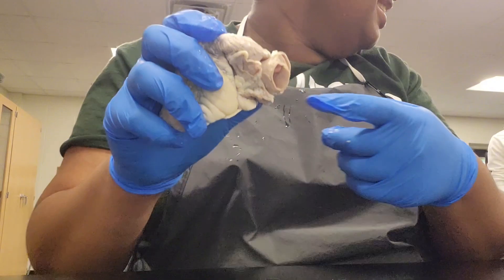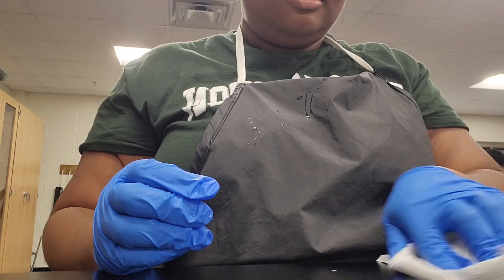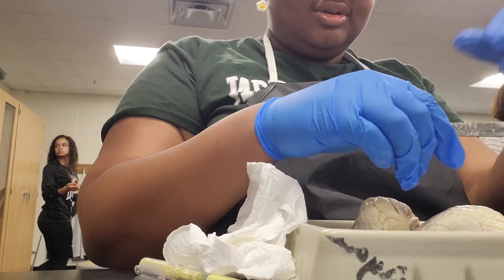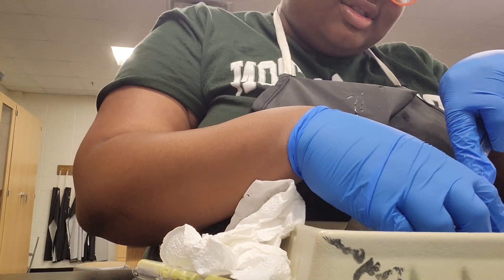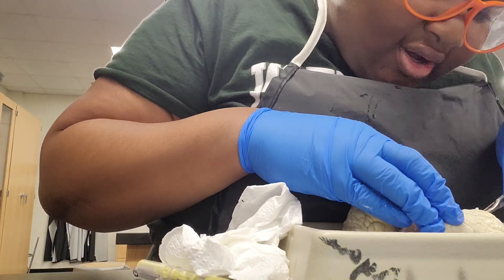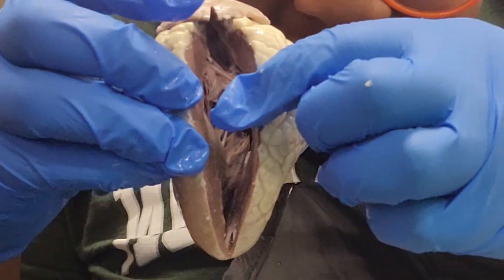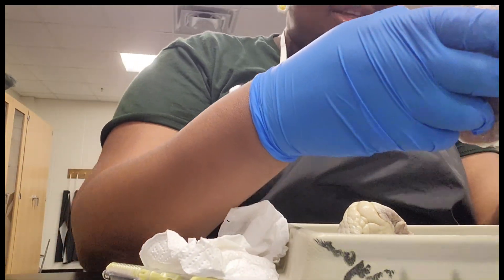I apologize for the weird unfunny jokes — I was on two hours of sleep and a vitamin energy when I walked in here, so I was loopy. Then I proceeded to dissect the heart even more because I was trying to see the heartstrings and find where that cavity went. Here we can get a better view of the chordae tendineae — I apologize if I pronounce that wrong — but basically those are the tendons that allow the heart to beat.